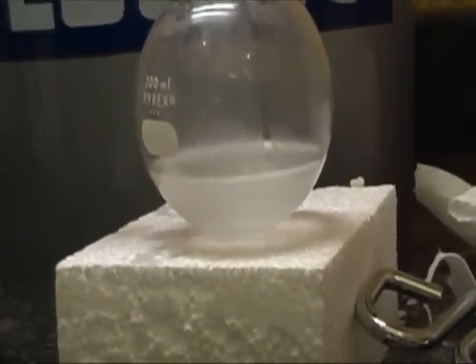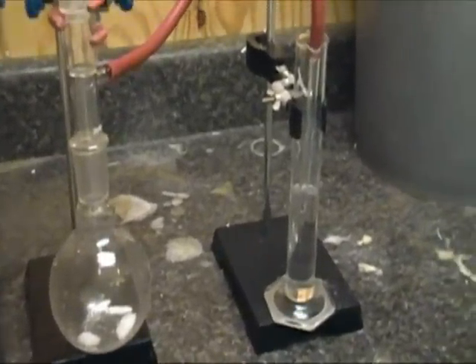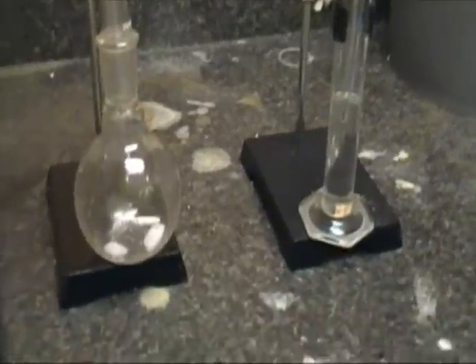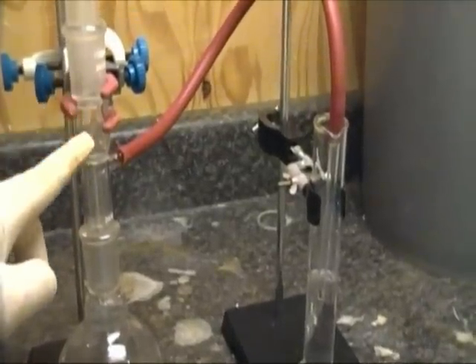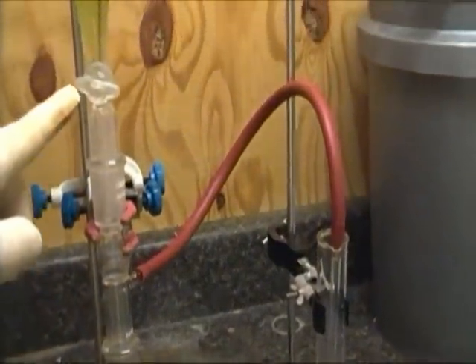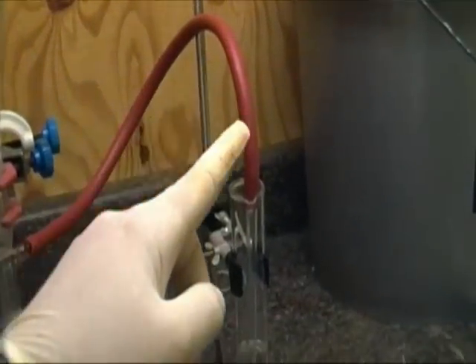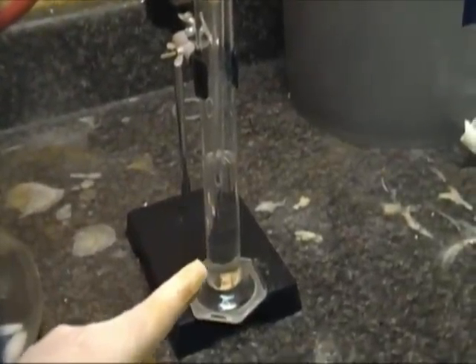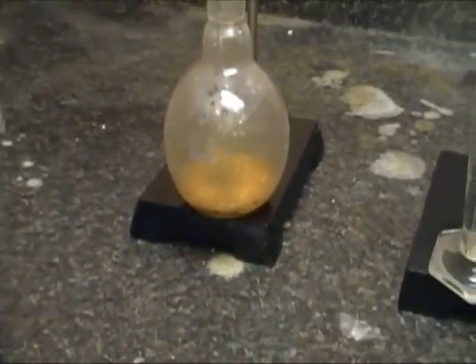Our distillation is done and we now need to make up a solution of bromine and dichloromethane to test if we really do have cyclohexene. If you do not wish to test your product, you can skip this step. You'll need to put together a gas generator to generate the bromine. In the flask are some pieces of potassium bromide. The flask is attached to a straight vacuum takeoff adapter with a sep funnel on top containing concentrated sulfuric acid. Attached to the vacuum takeoff is a hose with a glass rod on the end, placed in a graduated cylinder with however much dichloromethane you wish to add bromine to. Once set, begin adding your acid in slowly — it will immediately start forming bromine gas and other very toxic gases. You don't want to breathe any of these gases, so be sure to do this outside or in a fume hood.